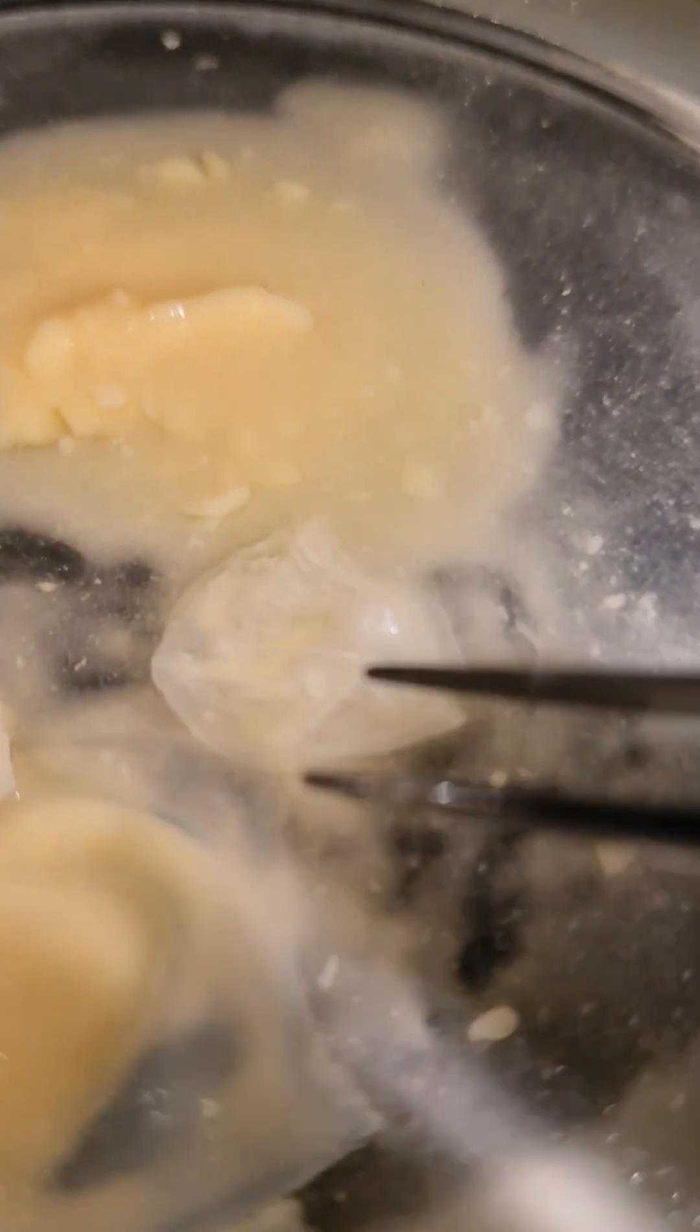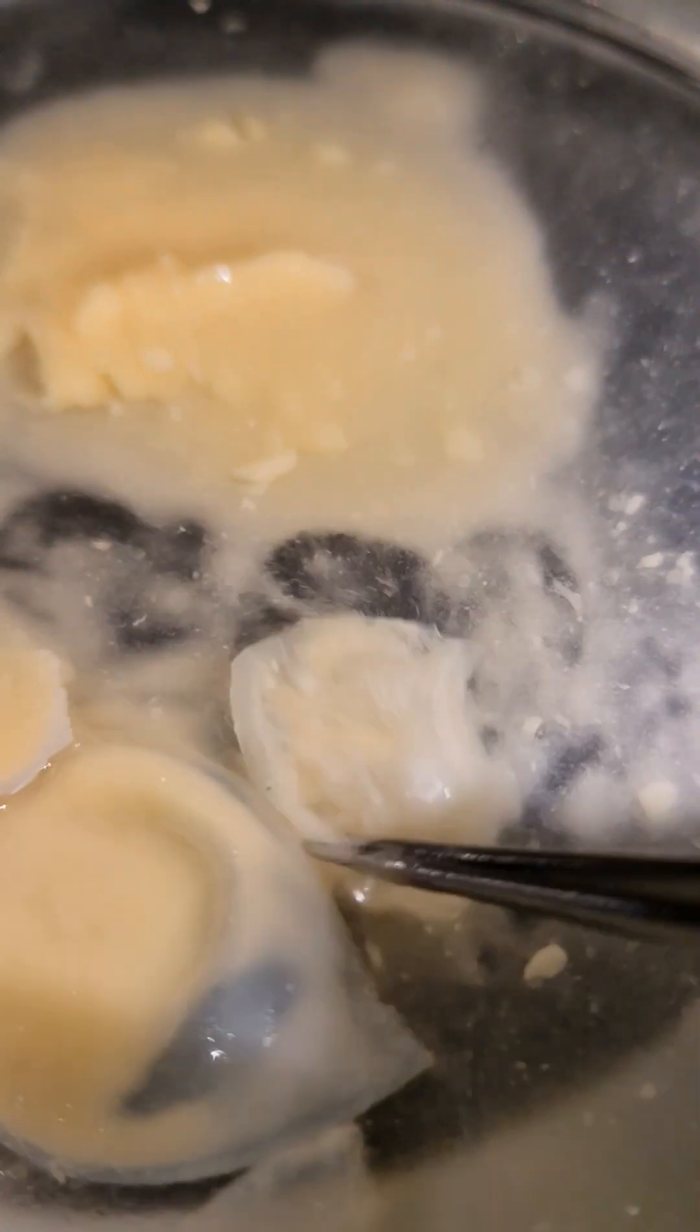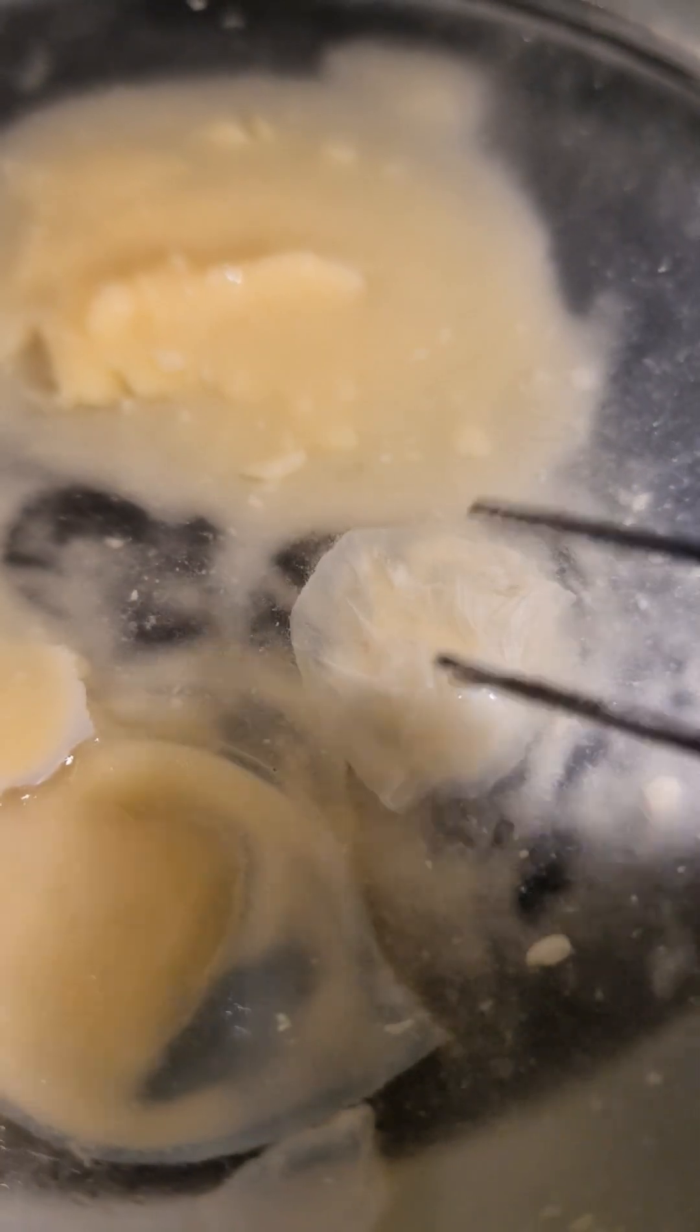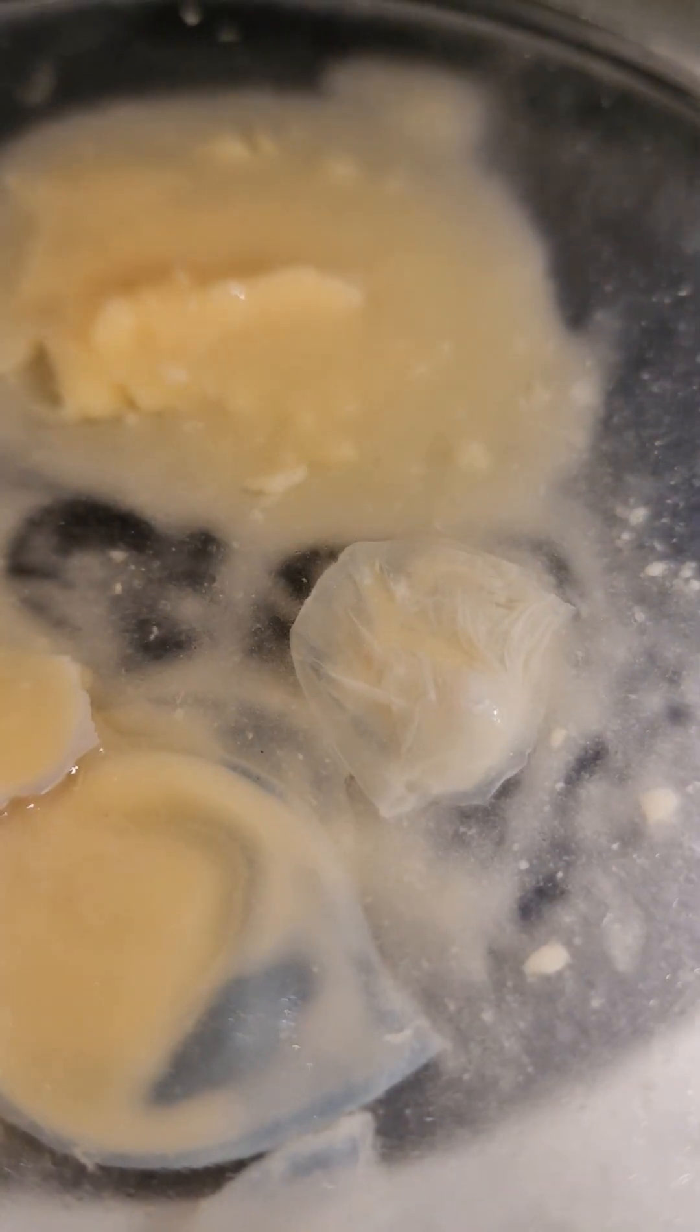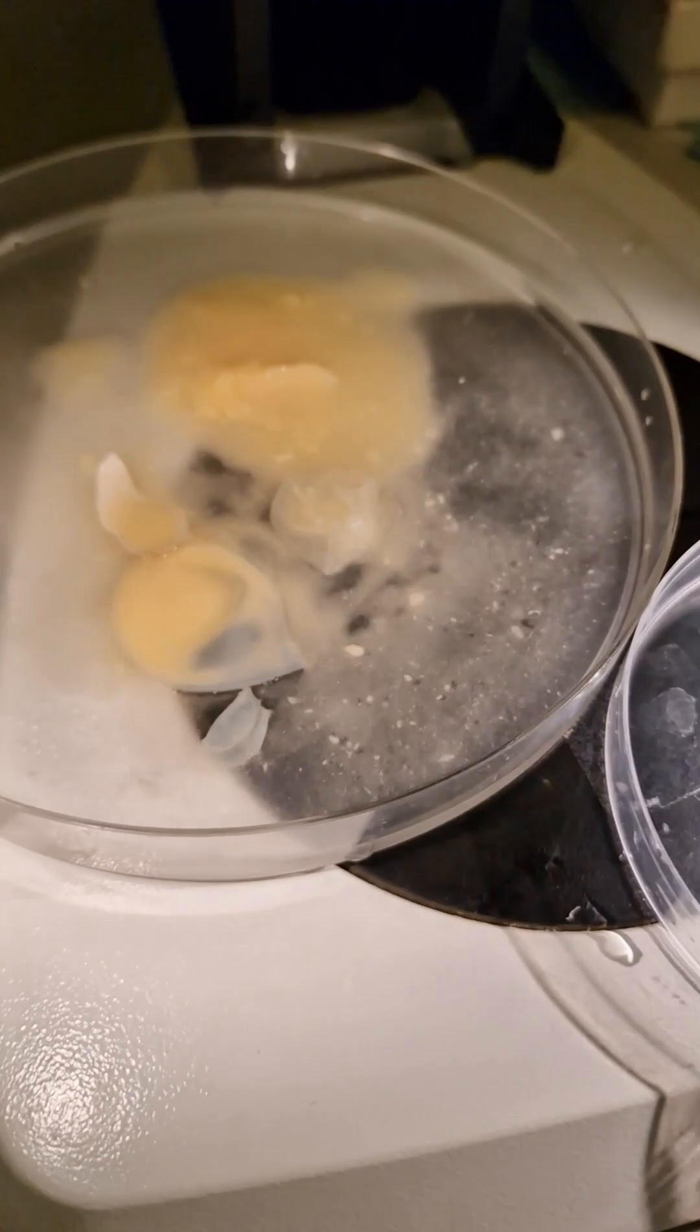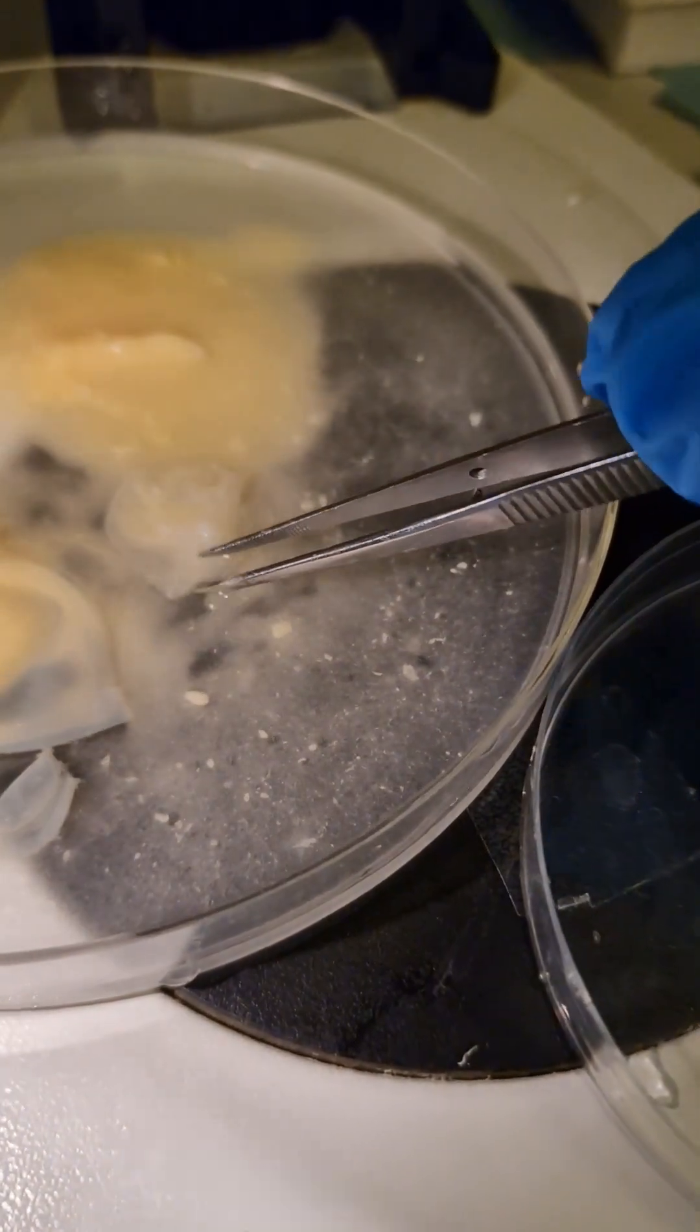Take a closer look at the sea turtle egg. This part here can hold something that you really don't expect. This is a failed sea turtle egg that was sent to me to find out why nothing developed, so we're going to use this special piece here to identify whether this egg was fertilized or not.